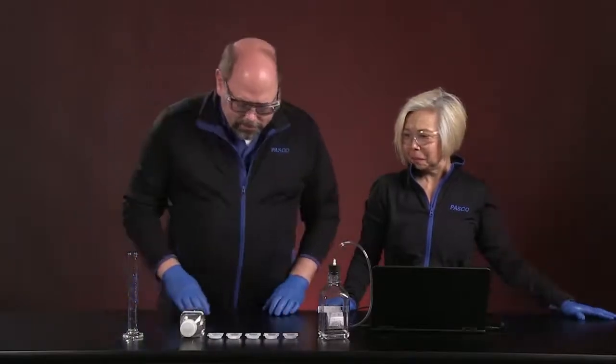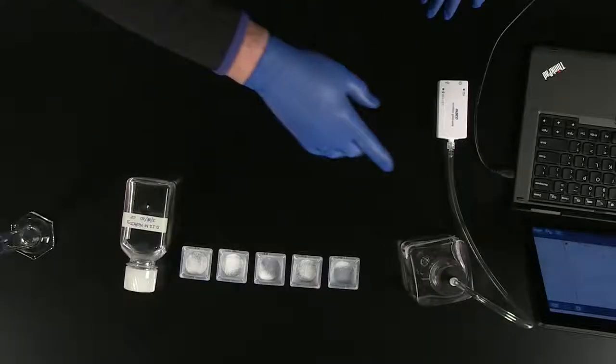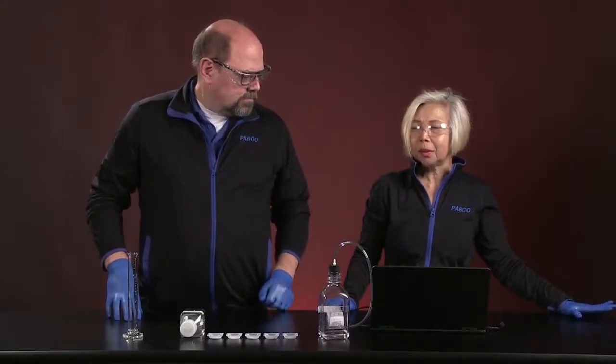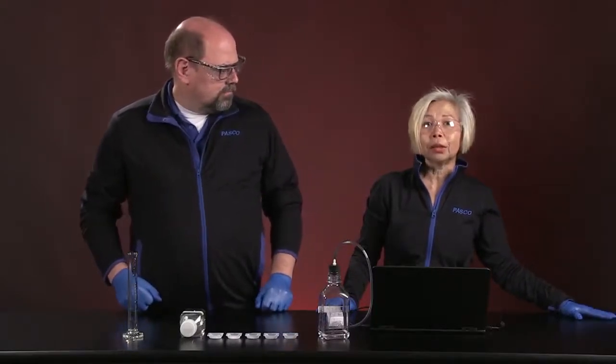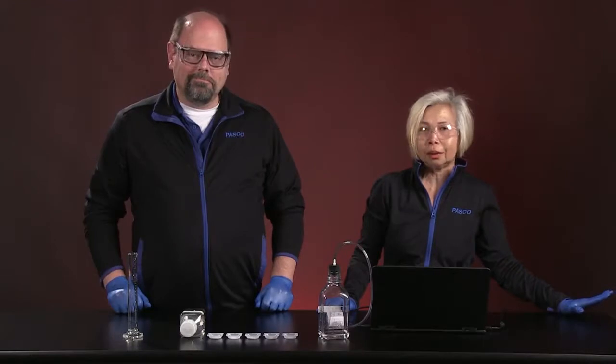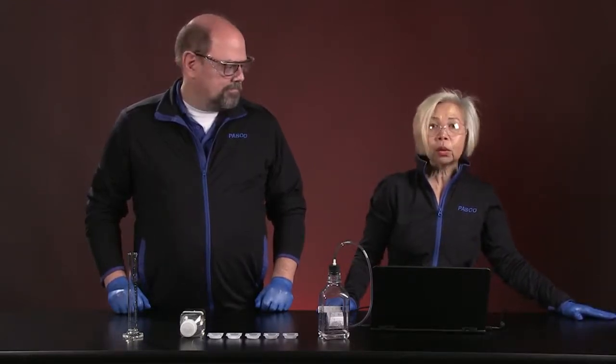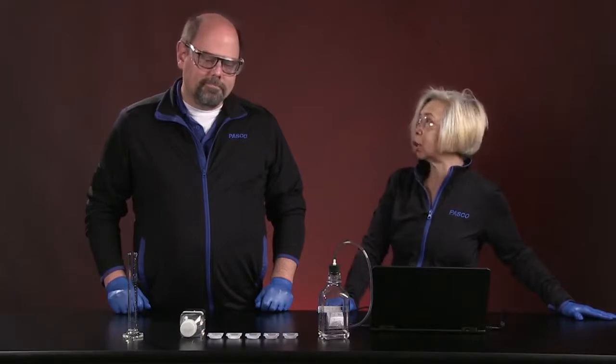Carolyn, we've got some great amounts of crystal and material here and some solutions. What are we doing today? We are actually going to study limiting reactants and stoichiometry. It's my favorite subject in chemistry. But before we do anything, let me ask you this very important question: have you ever made chocolate chip cookies?